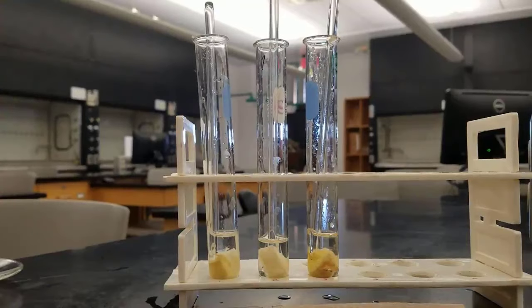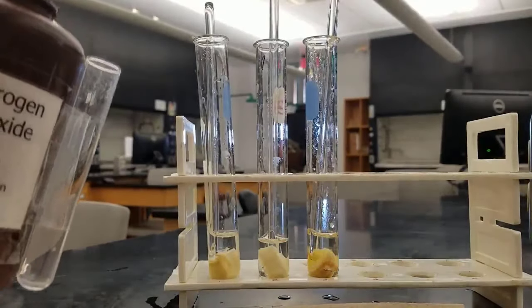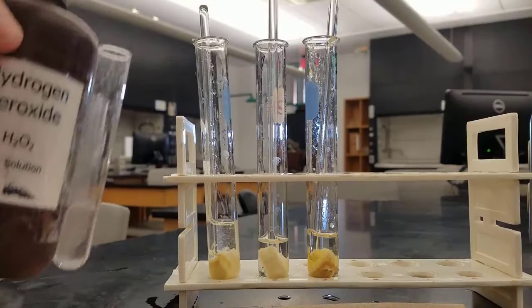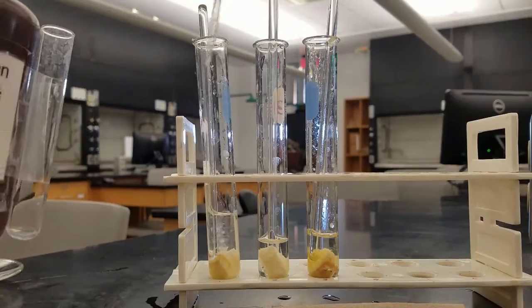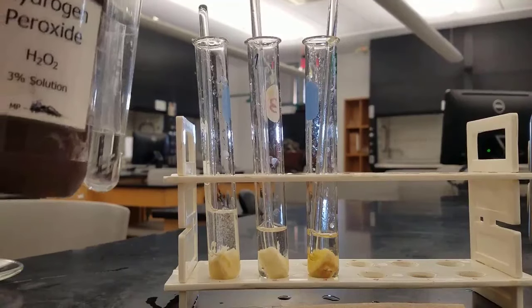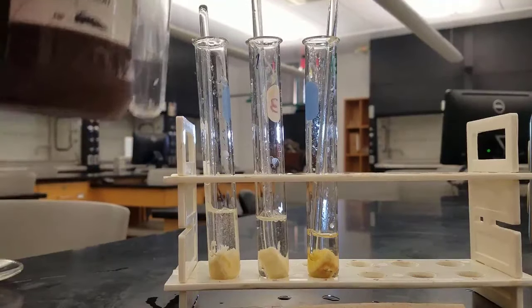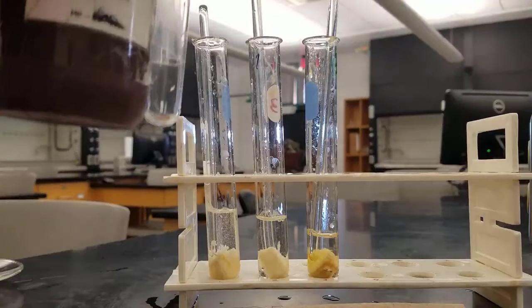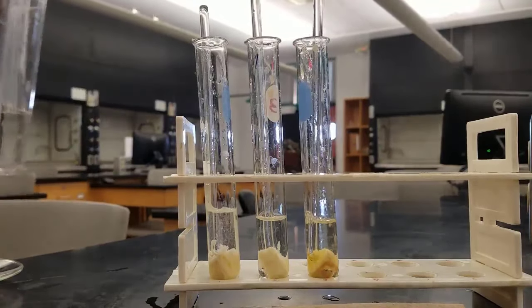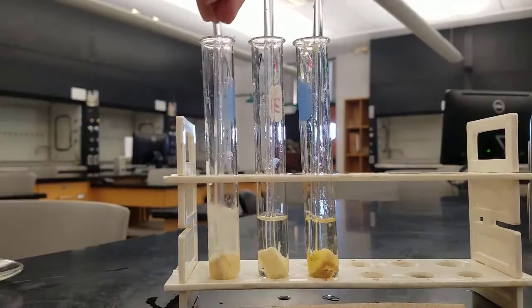Right now we've just got the enzyme in the banana sitting in water, acid, or base. Now we're going to add the substrate — the hydrogen peroxide — and we're going to add an equal quantity to each test tube, so a couple of squirts to each. We didn't expect to see a reaction before because we didn't have a substrate, but now we've got a substrate, so if there is a reaction, remember we're going to look for bubbling.